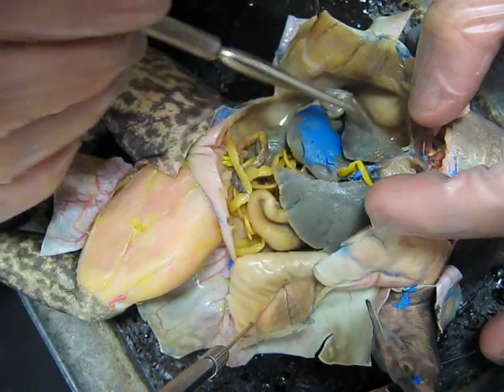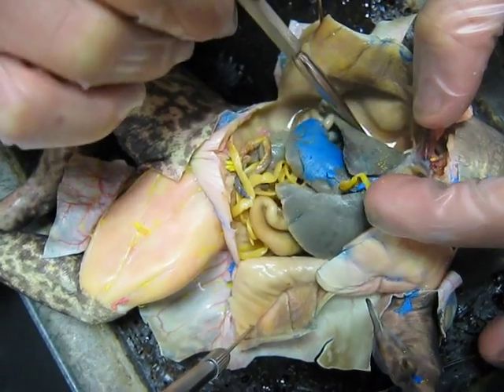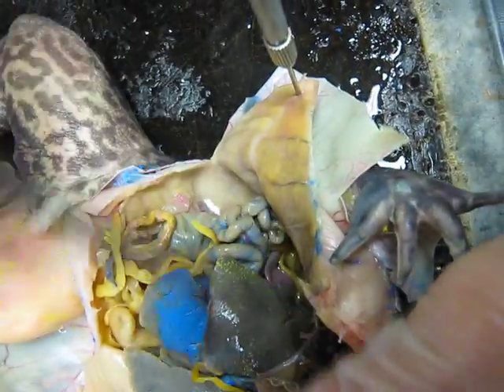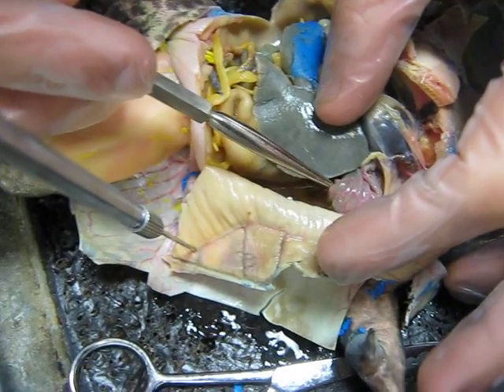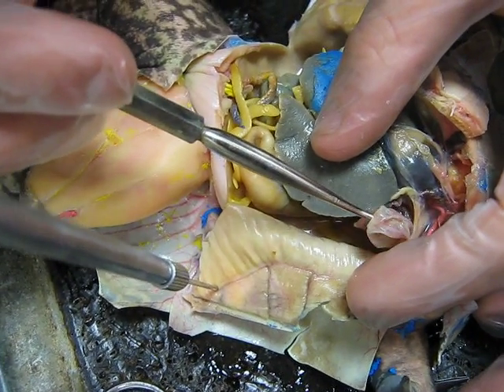This is the liver, right here. And this is the lungs, on either side.